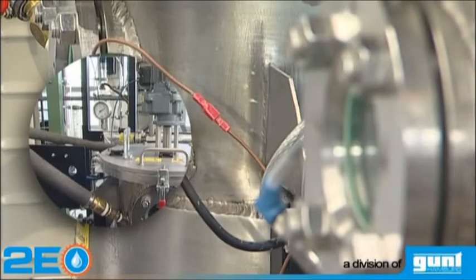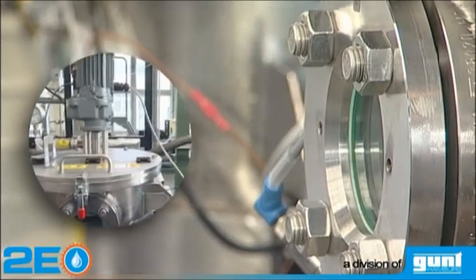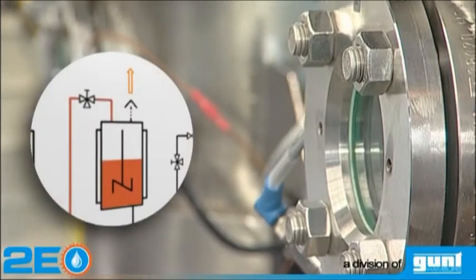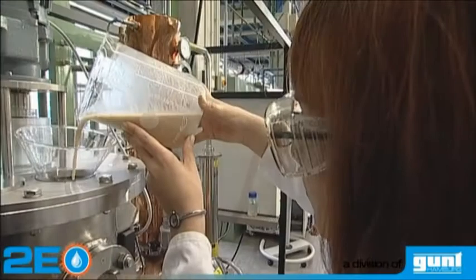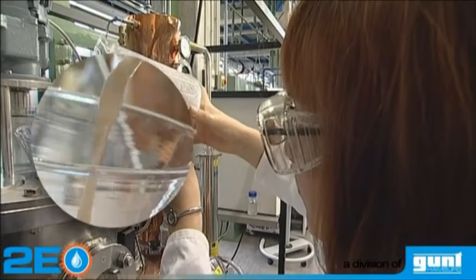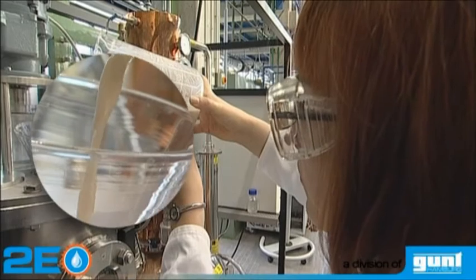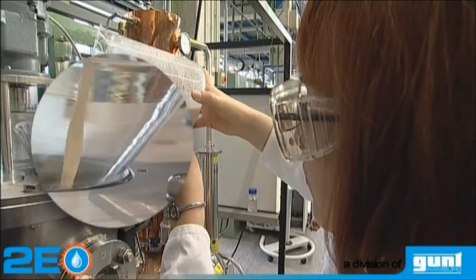The mash is cooled and pumped into the fermentation tank. After adding the yeast, the three-day fermentation phase begins.